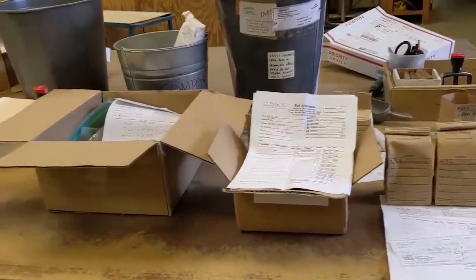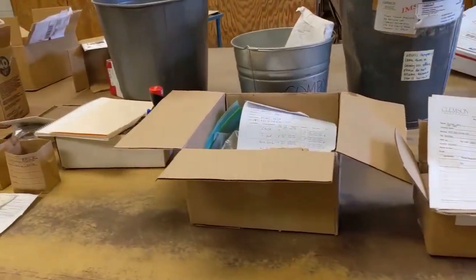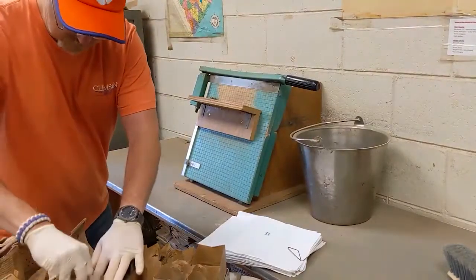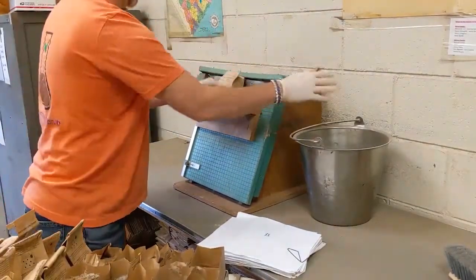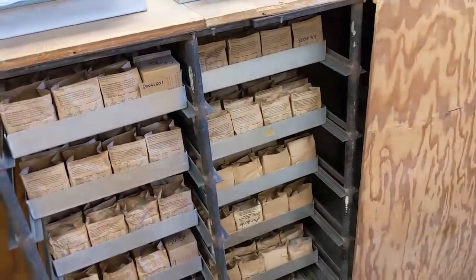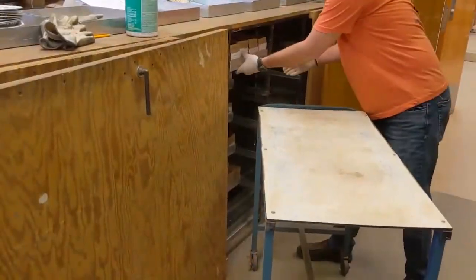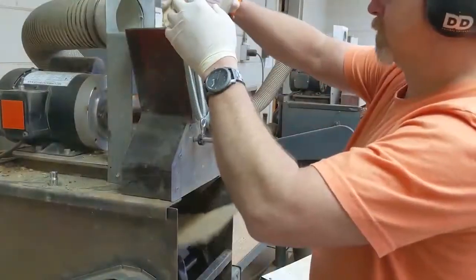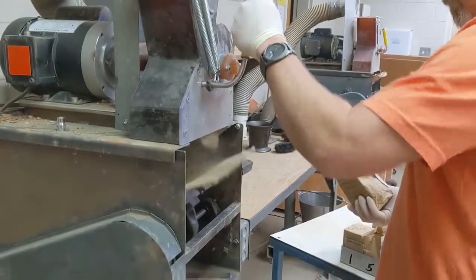Today we're going to show you how we analyze the mineral content of our soil samples. As seen in our previous video, soil samples have to be prepared before they are analyzed. This includes organizing them into sets, removing the top, drying them overnight, and grinding the sample to create a uniform particle size and homogeneous sample.